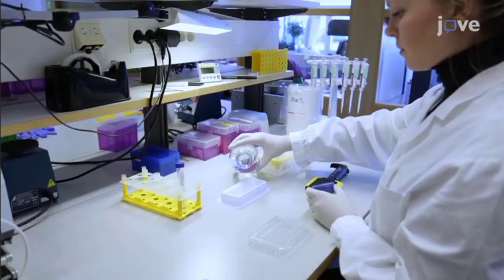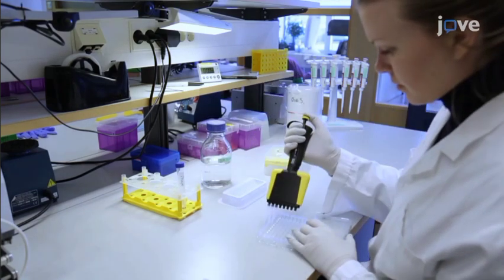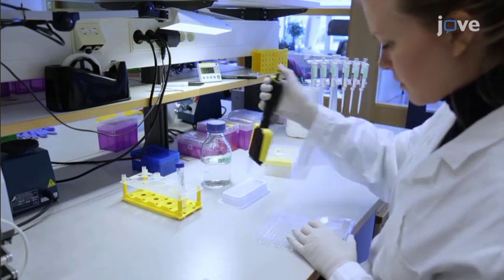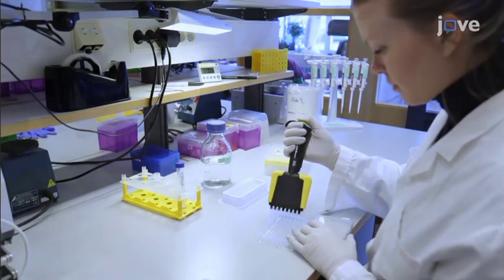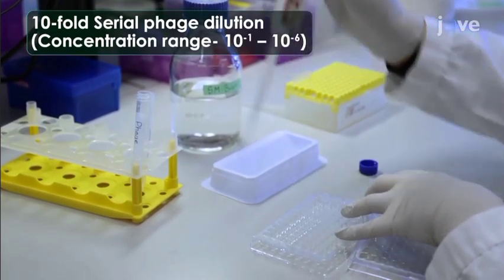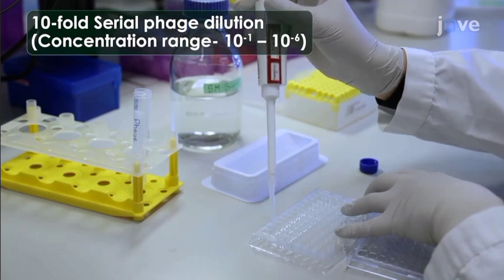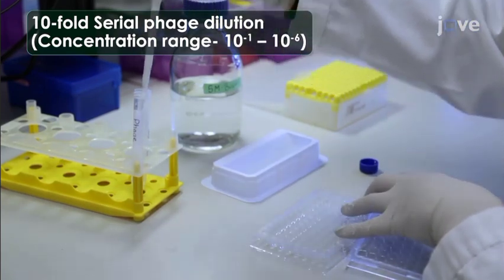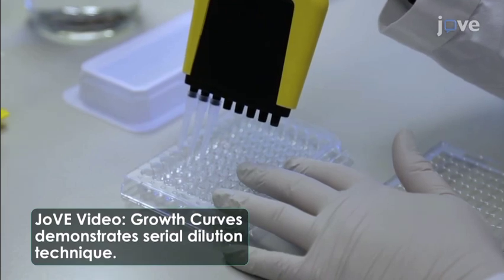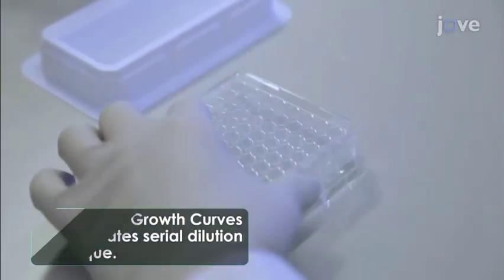Phage titers can vary exponentially across different phage types and samples. So in order to count them effectively, they should be diluted to generate a wide range of phage concentrations. On the day of the assay, generate a series of phage dilutions ranging from 1/10 to 1/1,000,000th concentrations, following a 10-fold dilution technique. To obtain statistically significant and accurate data, perform the serial dilution in triplicate.